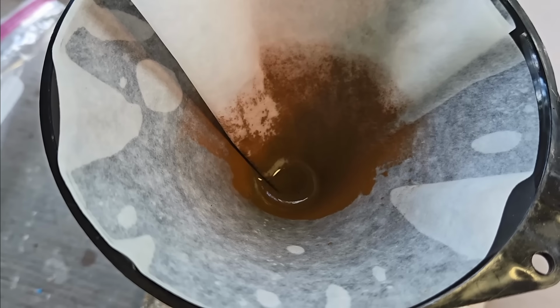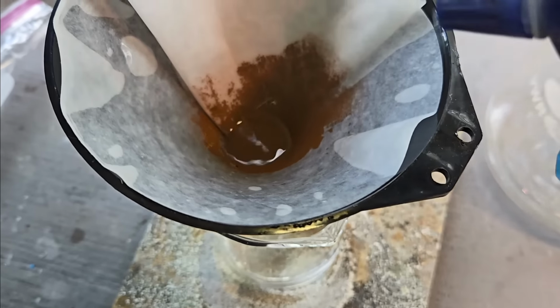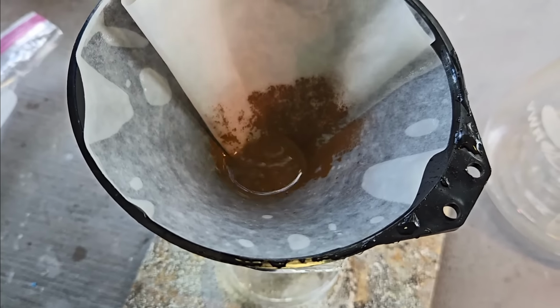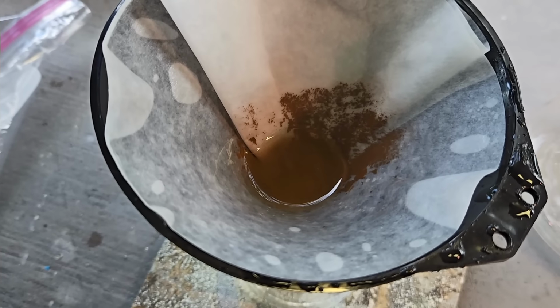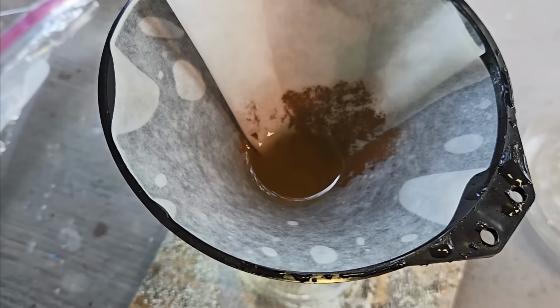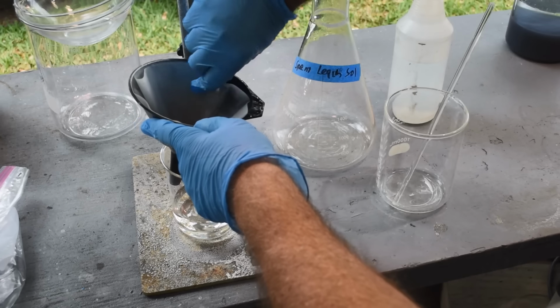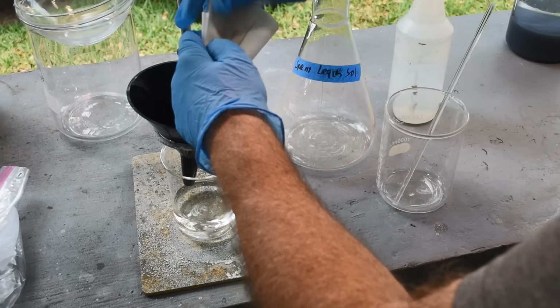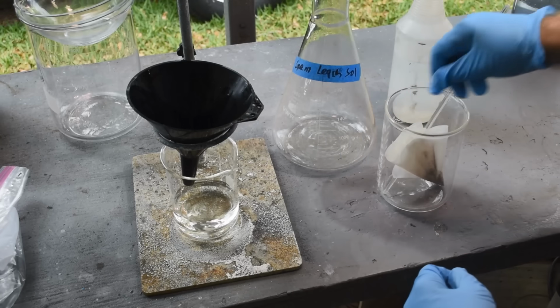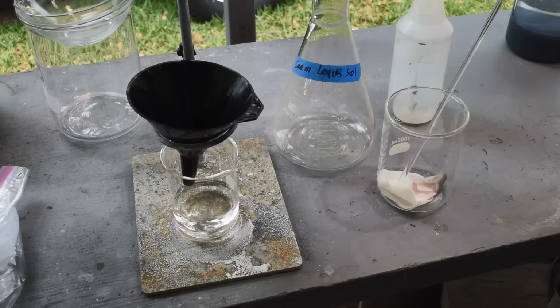Well, there it is, whatever it is. Let me rinse it down with some distilled water here. Let that drain through. And we'll put this in some aqua regia and figure out if it's gold or not. All right, let's find out what this crap is, or isn't. There we got whatever it is down here in the bottom of the filter. You know what, I'm just going to put the whole filter in. Let's get this in the fume hood and make some aqua regia and then do a stannous chloride test on it. See what we got.